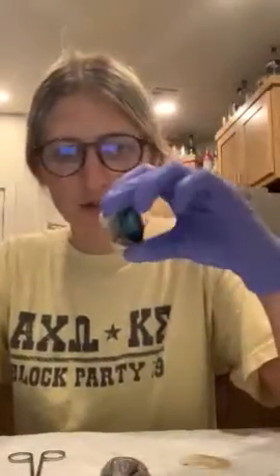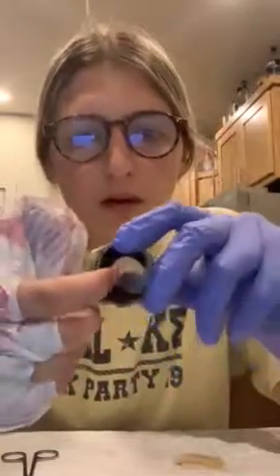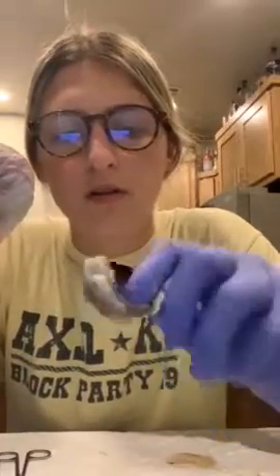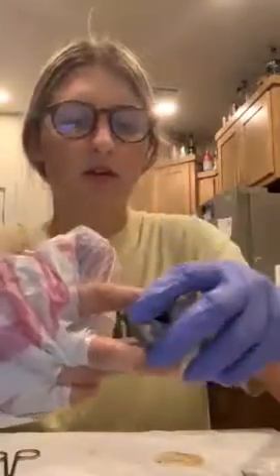Here is the anterior cavity and then this is the posterior cavity. On the anterior cavity we have the cornea right here, and when you flip it, in between these is the pupil and then you have the sclera. The liquid in between the lens and the cornea is the aqueous humor, and then the liquid or gel in between the anterior and posterior cavity is the vitreous humor.